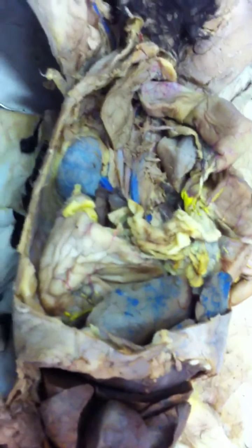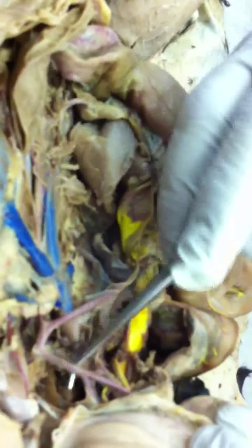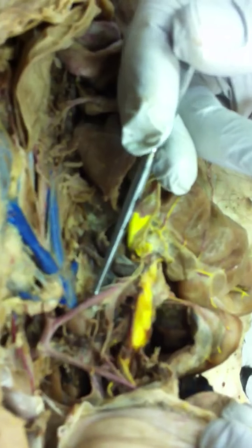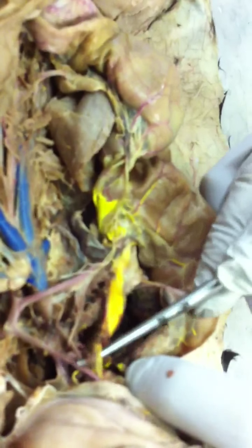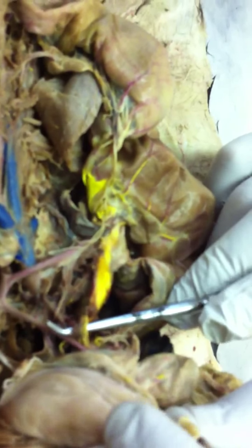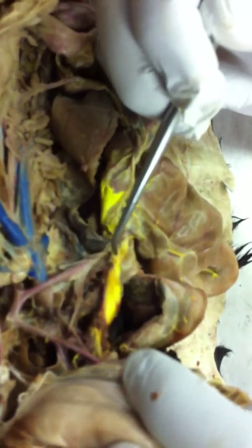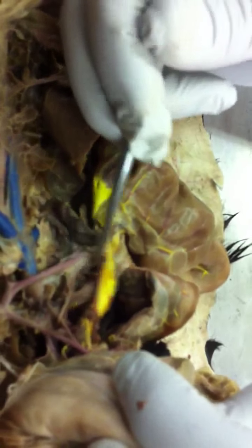Okay, so here we go. To get your frame of reference, I always do this for myself. There's the aorta, there's the celiac trunk, and there's the superior mesenteric artery, all three arteries. You with me on those? Okay, right next to the celiac trunk, running in the opposite direction, is the gastrosplenic vein. The gastrosplenic vein is carrying blood out of the stomach and the spleen toward the liver. Running along, but in the opposite direction to the superior mesenteric artery, is the superior mesenteric vein.